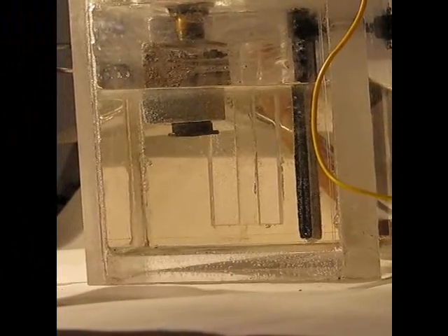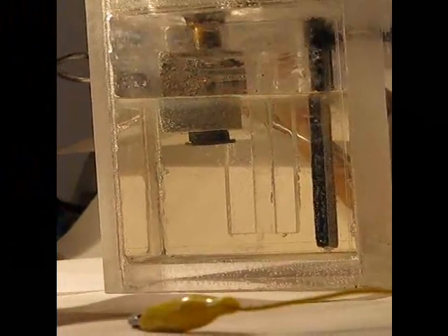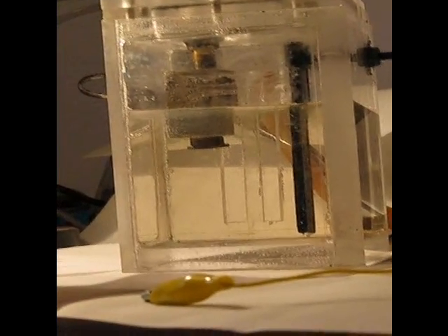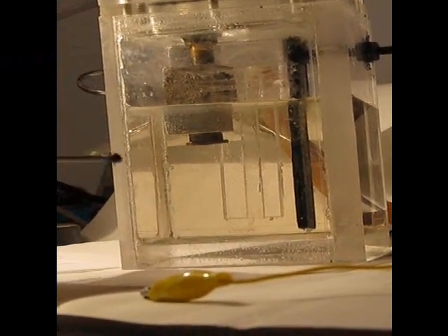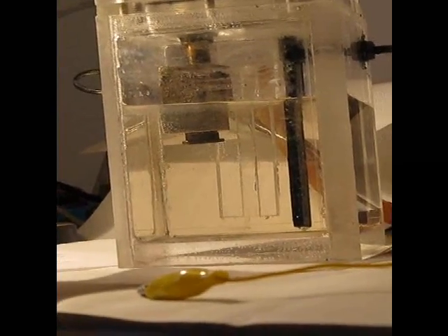So what I want to do is show the controllability by disconnecting the lead. We'll see the hydrogen production on the nano-nickel slow down and cease. Pay close attention to the aluminum, and still we see that there's almost no reaction on the aluminum. Very little. In fact, I can't see any reaction at all.